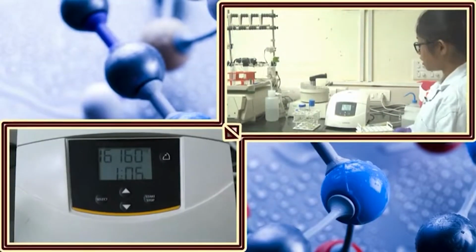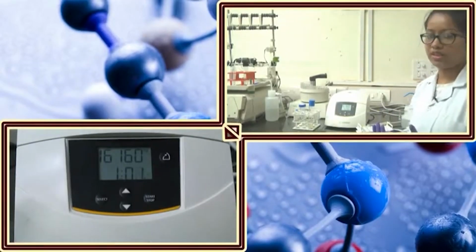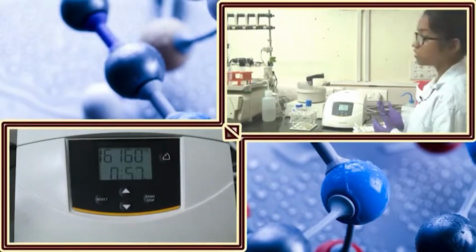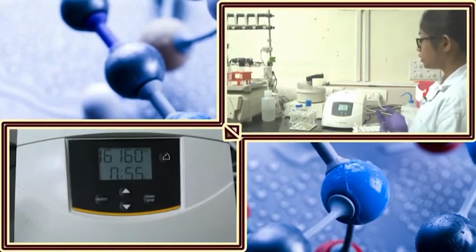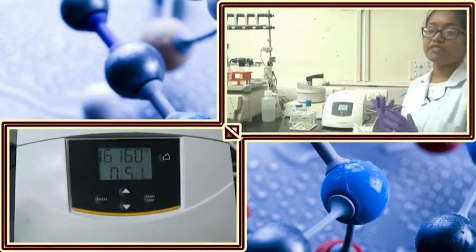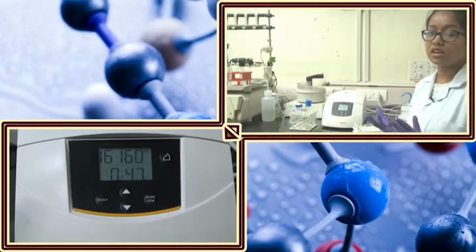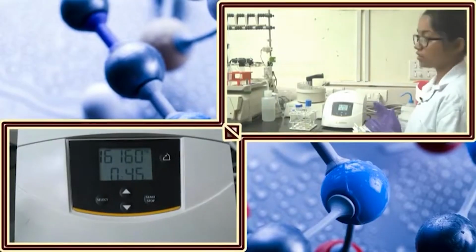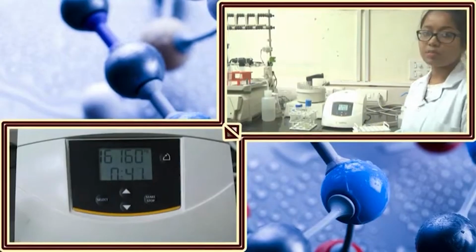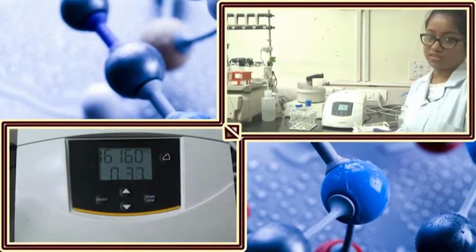Another thing about centrifugation is that if it makes too much noise, or if it is showing an error or anything else which is not usual, then you should immediately stop the centrifuge machine, because the rotor is rotating at a very high speed. If there is any kind of imbalance or proper leveling was not there, it might cause some kind of accident in the lab. So you should always be very careful while doing a centrifugation process.